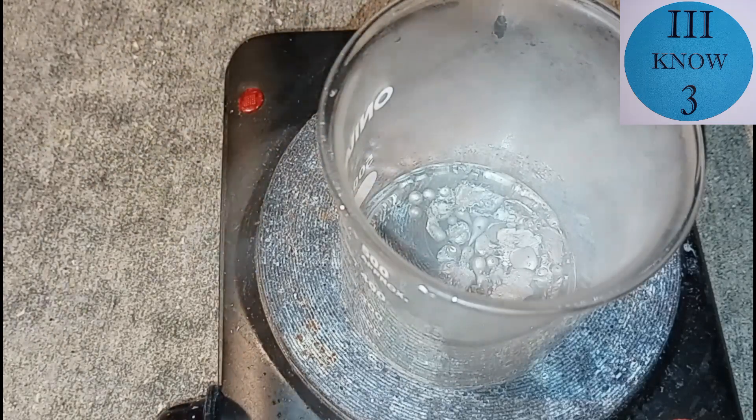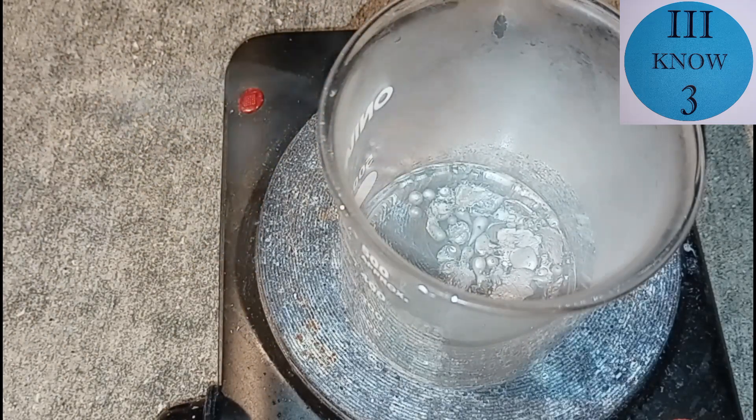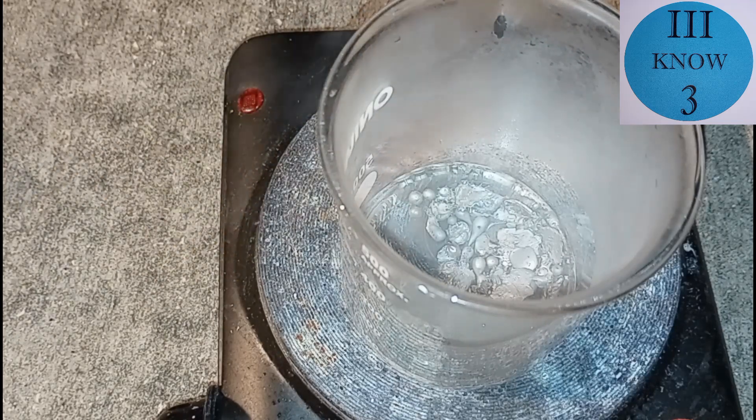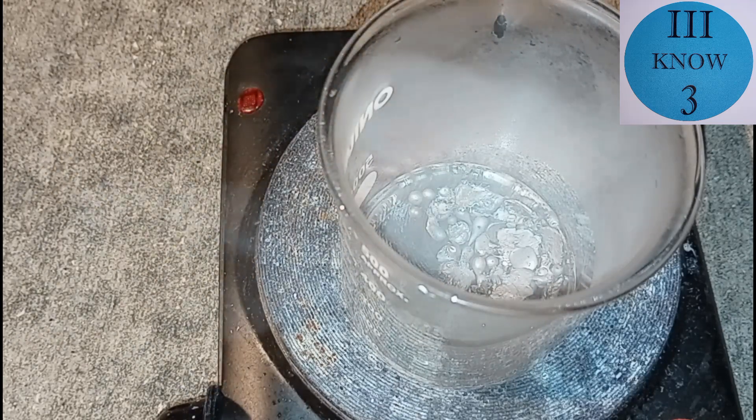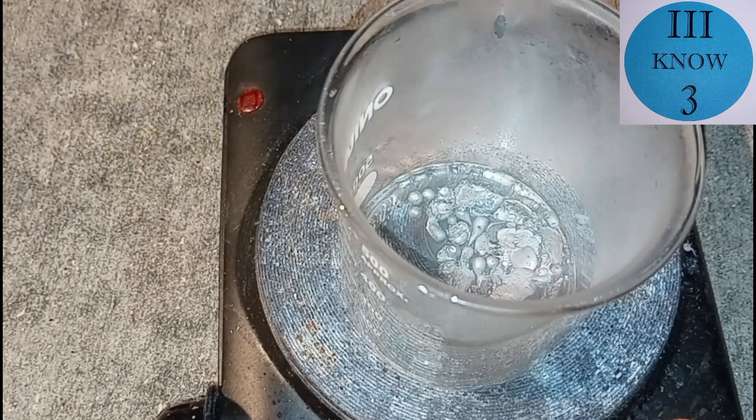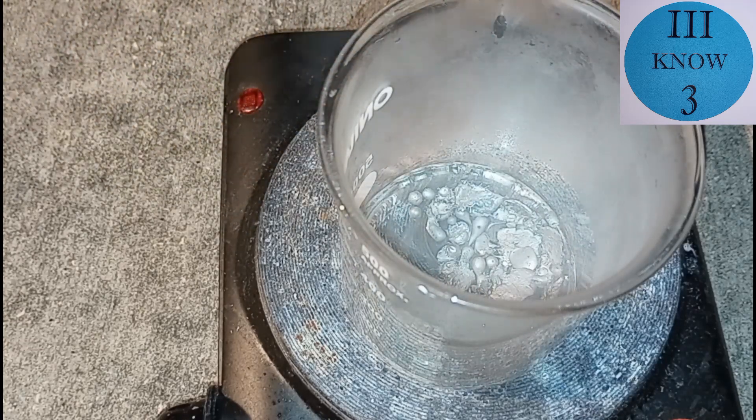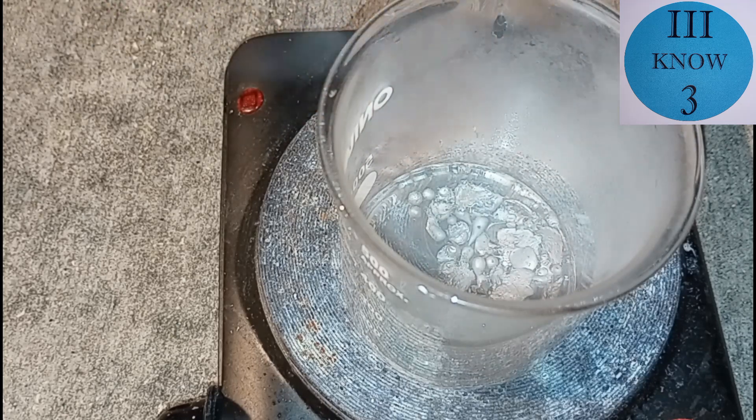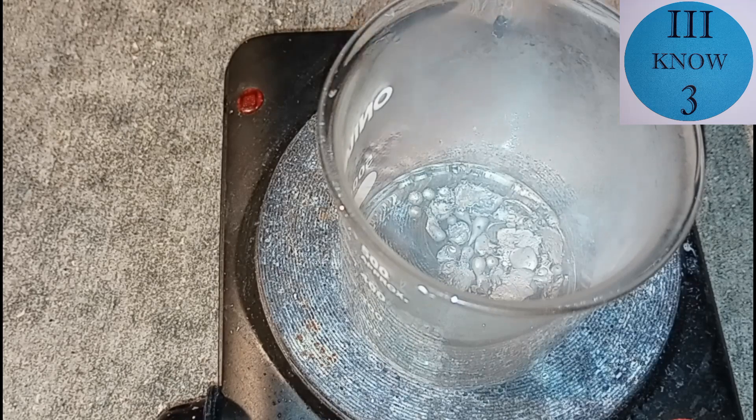It's starting to get hot here. And most of the fumes that are coming off are mostly water vapor. They may contain a little bit of chlorine gas, but not much because the temperature is pretty low. I really don't want the chlorine to escape in a gas form because I want it to stay in the solution and combine with the tin that's getting dissolved.